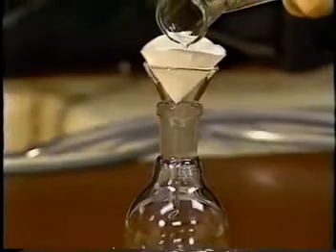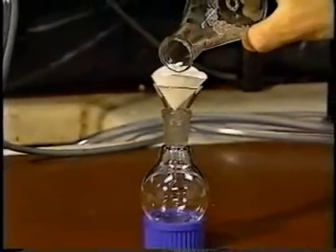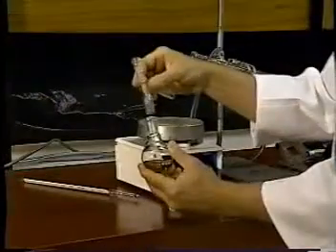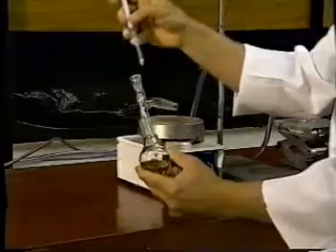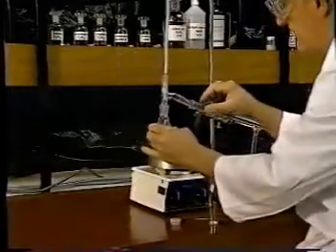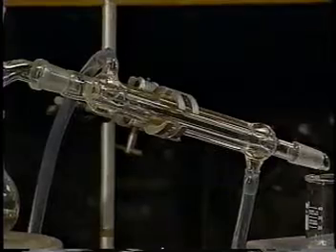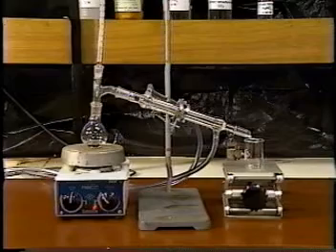We're filtering this into a round-bottom flask because the last step is to distill the ester to get it pure. We assemble our glassware, make sure there is a tight fit, and put the thermometer in — it will indicate when we are at the correct temperature to collect the desired distillation products. The connection to the condenser is checked and the cooling water is turned on.